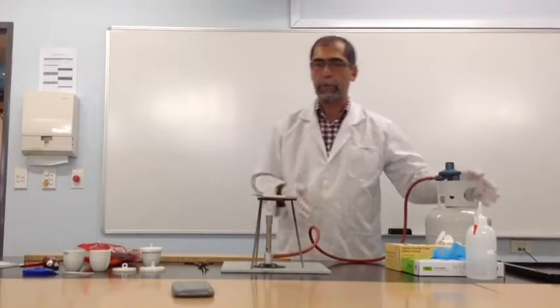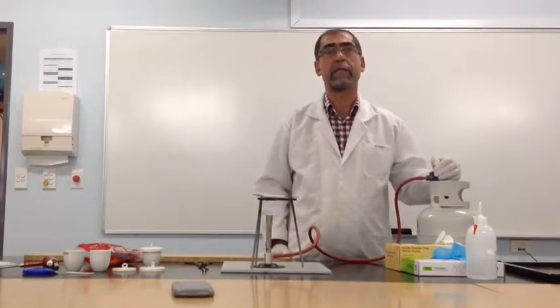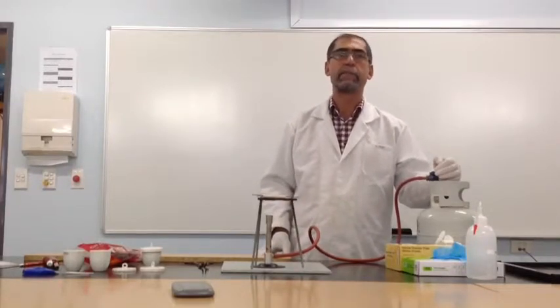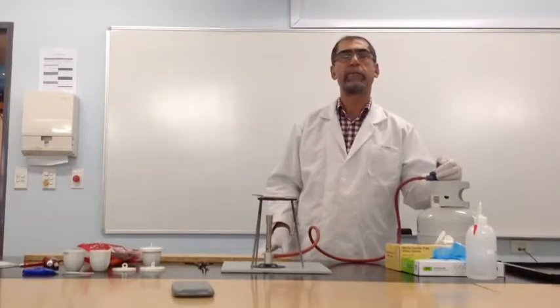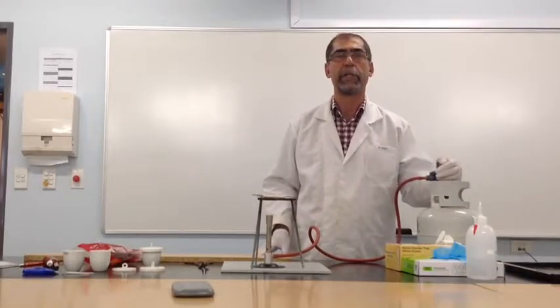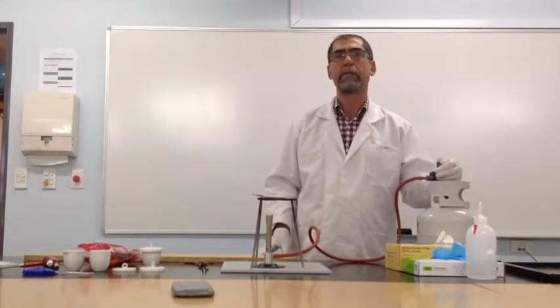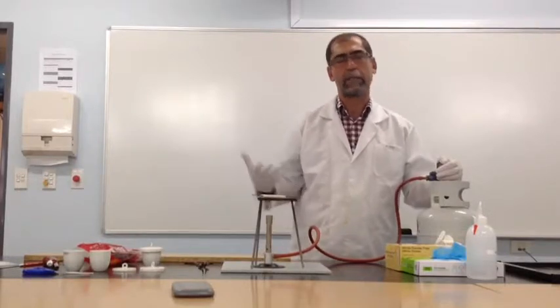From my experience, I prefer using LPG gas for the ignition of the magnesium in the crucible. It just makes it much easier. Methane is a cooler flame than LPG, it takes much longer, and you probably have to start the ignition in other ways.